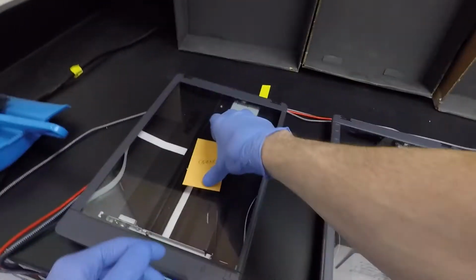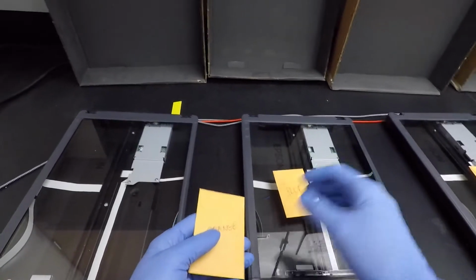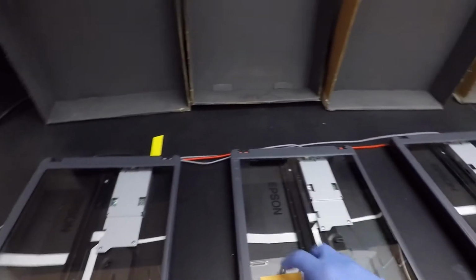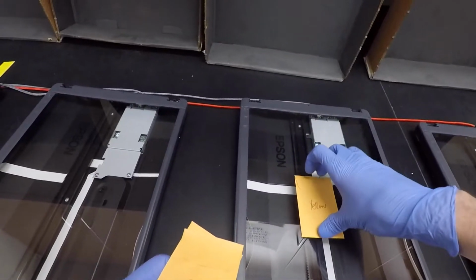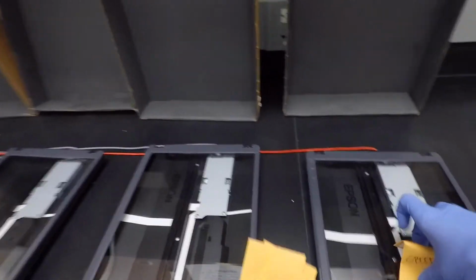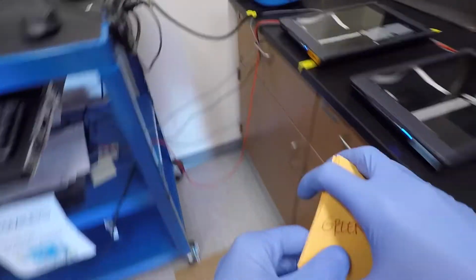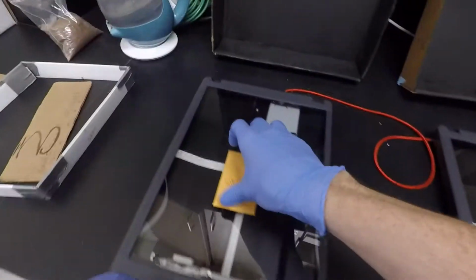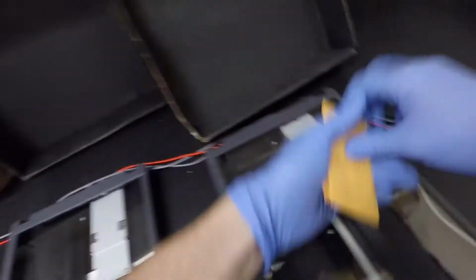What I'm going to do now is that we have these off, being very careful not to touch the glass. I'm going to remove these. It's a little bit difficult, but if you gently press on the back here, you should have enough of a lip to pick these up, and that's one reason why it's a good idea to wear gloves, just so we don't get our oils onto these scanners. Do the same thing here, pick them up, and I like to just keep these off to the side there.